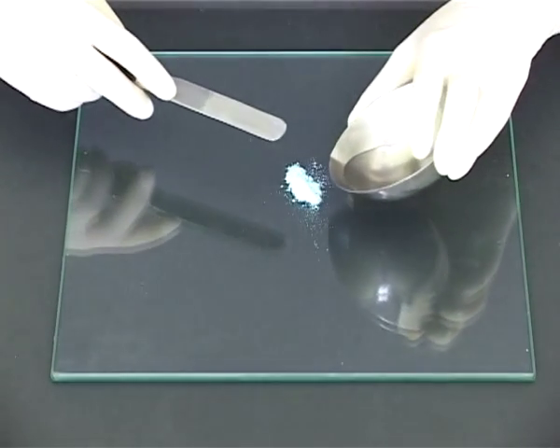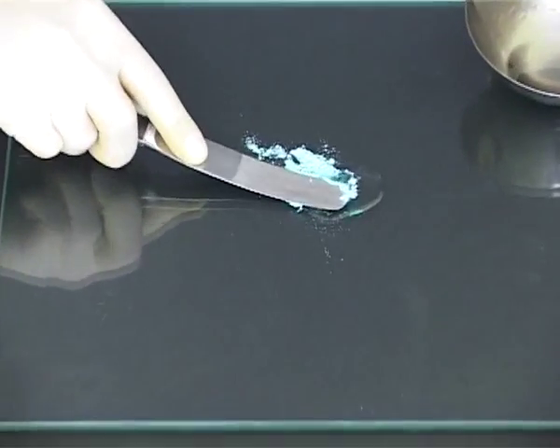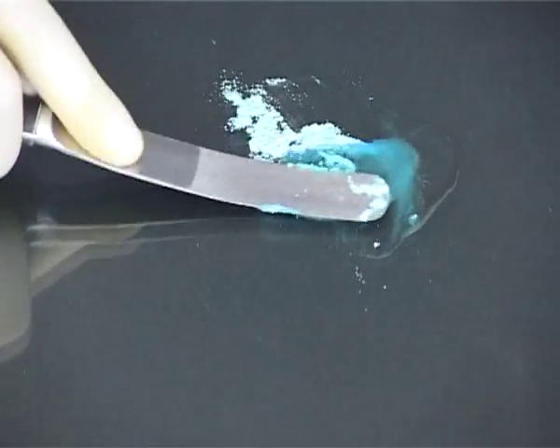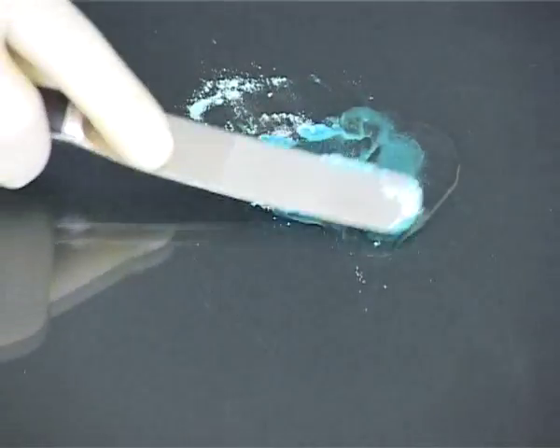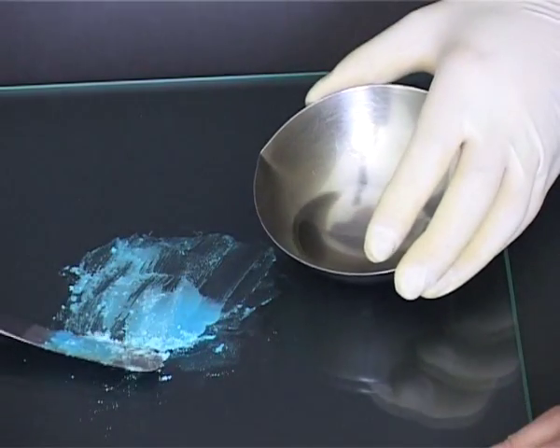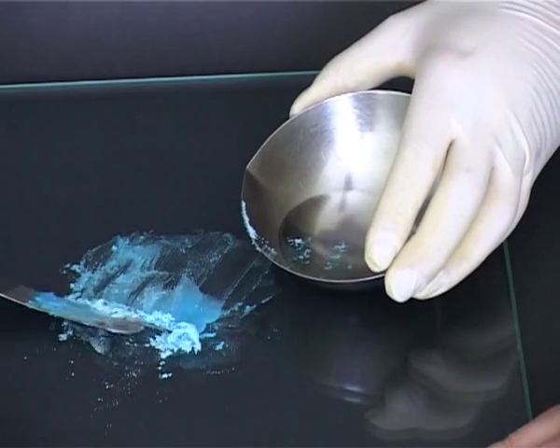A minimum amount of molten base is added to the finely ground powder already on the tile. The insoluble solid is then incorporated into the base by levigation which is also called wet grinding. The shearing effect between the tile and the spatula will not be achieved if too much molten base is added and the resulting product will be gritty and unpleasant to use.